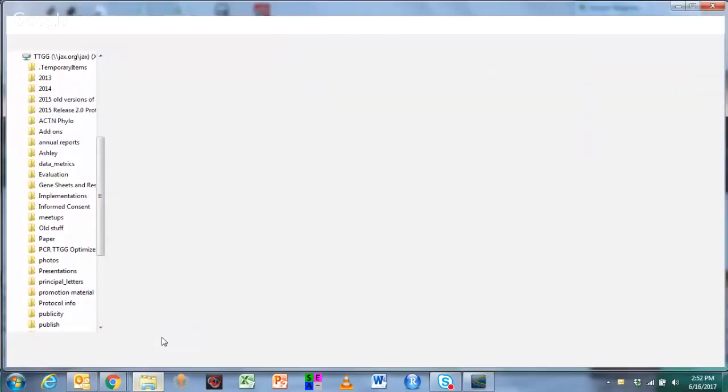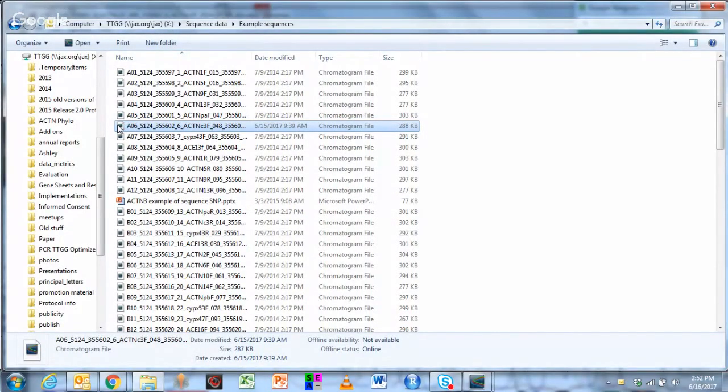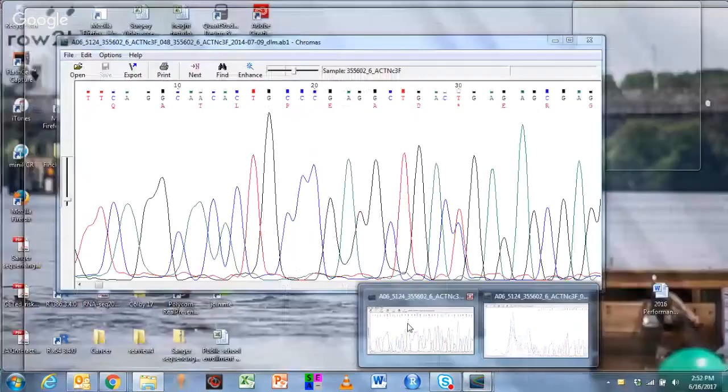In black. I'm going to go to the example sequences here. These are sequences generated by students. They're being opened in Chromas. There are a couple of other software, so I'm going to open the sequence. It's already open, it looks like.